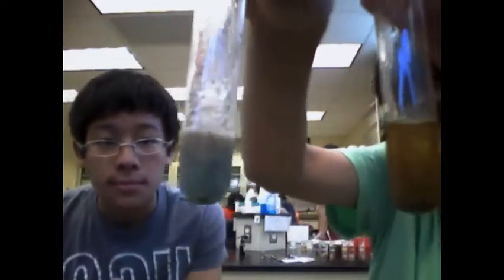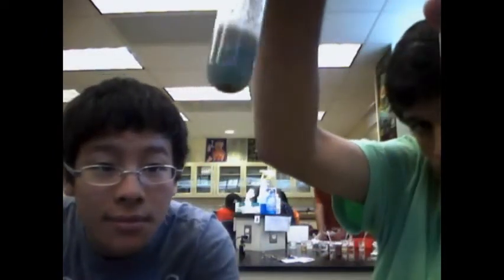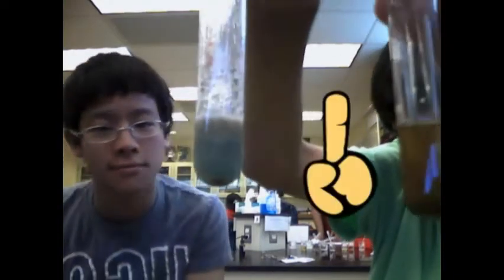Professor Philip, your verdict on unknown substance number 4? No. It may be hard to see, but this test tube contains a slight blue color, reminiscent of the Benedict's reagent. We can tell, negative test result.